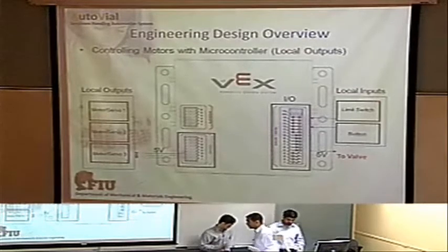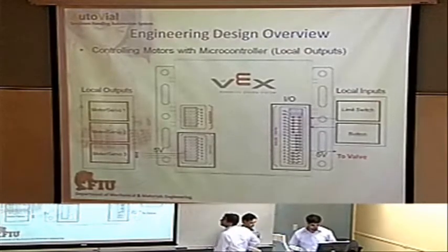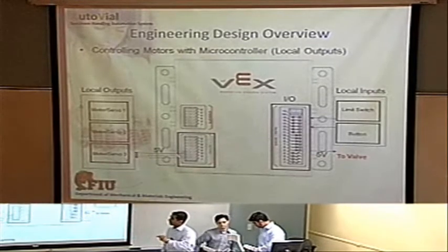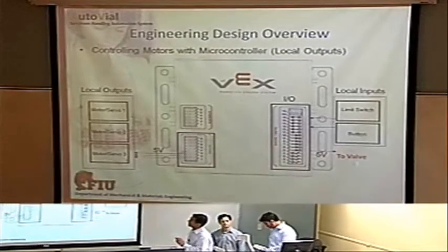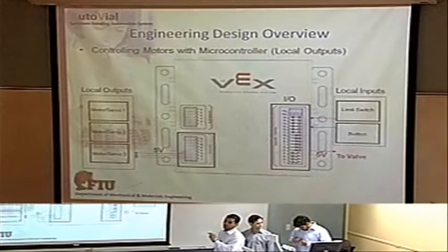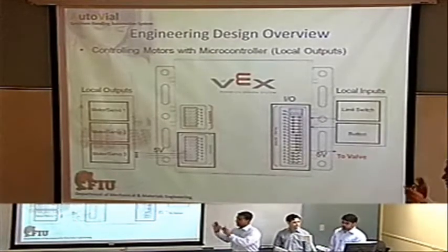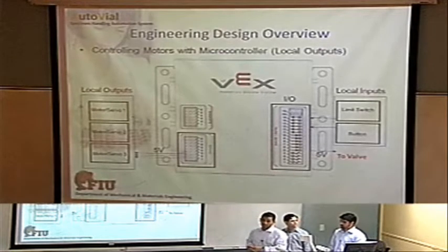In order to control our motors and sensors, we use the Vex Robotics microcontroller. You can see here, these ports are for the motors, and these ones are for the analog and digital inputs and outputs. These also can be used for the motors, so it's really expandable. It's really scalable, this Vex Robotics microcontroller.